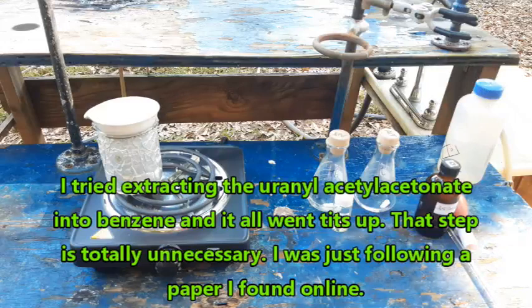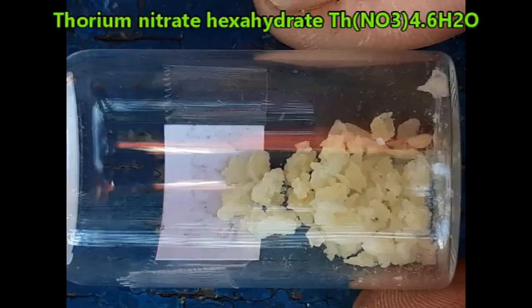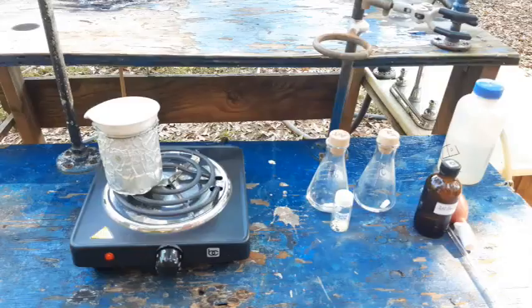For the thorium complex, I already have some thorium nitrate that I've made up here — you can see a nice picture of it. I made that by a metathesis reaction between barium nitrate and thorium sulfate. That was very standard prep, that's why I didn't film it — there really wasn't anything to see. It's a standard trick you guys have seen me do many times before.